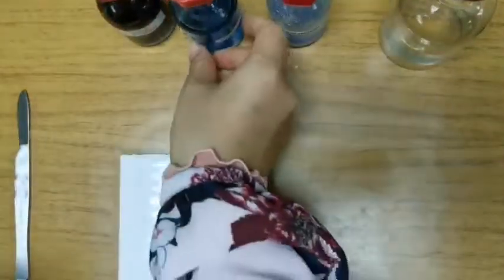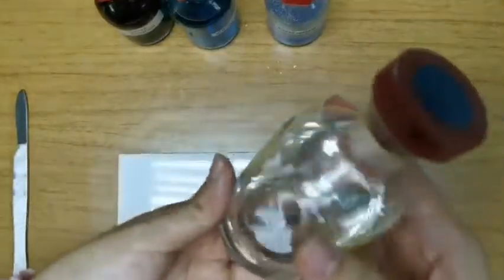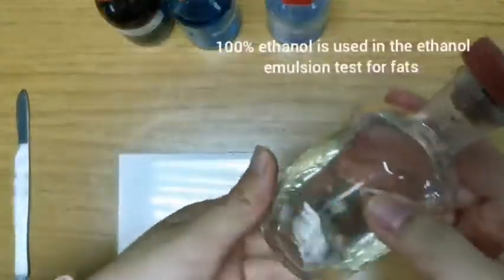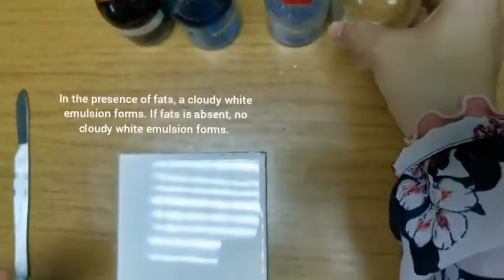The last one, the test for fats, is the ethanol emulsion test, and the reagent we use here is 100% ethanol or 100% alcohol. The label is not here, but it will be given to you next time.